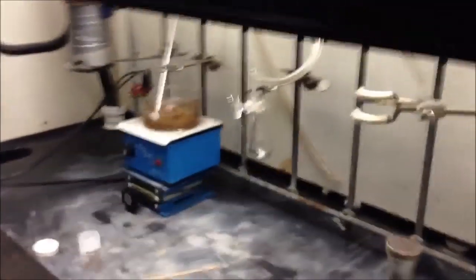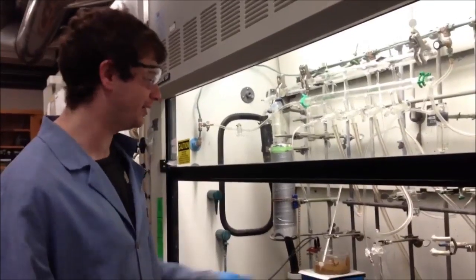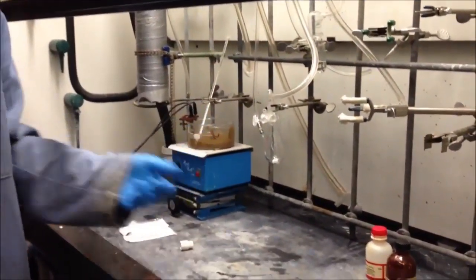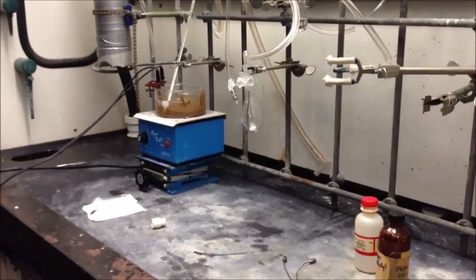Okay, so now we're going to let that cool and we'll check back in in another five minutes or so. Okay, five minutes have passed and it's cool to the touch. So we're going to go ahead and backfill now with an inert gas that's dry. So nitrogen gas would be the gas of choice.